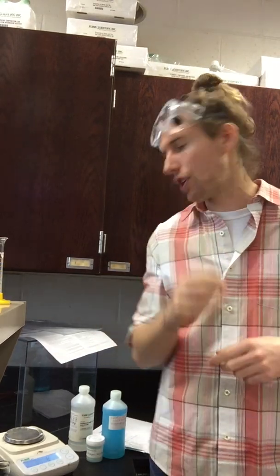This is your video for the empirical formula of copper carbonate lab. And if you're thinking to yourself, copper carbonate, it doesn't sound right. Shouldn't it be either cuprous or cupric carbonate? You're right. And that's what we're going to figure out here today: in an unknown sample, what are we working with? So here are the things I need you to have out.